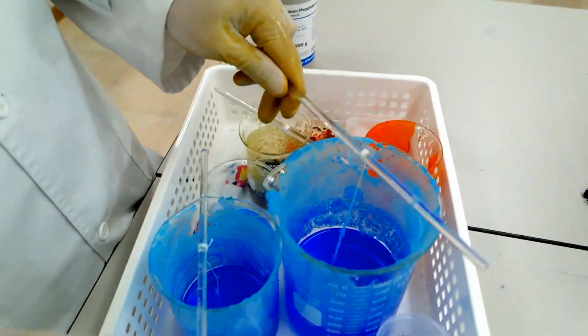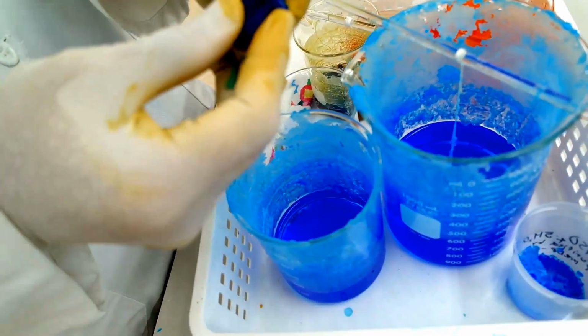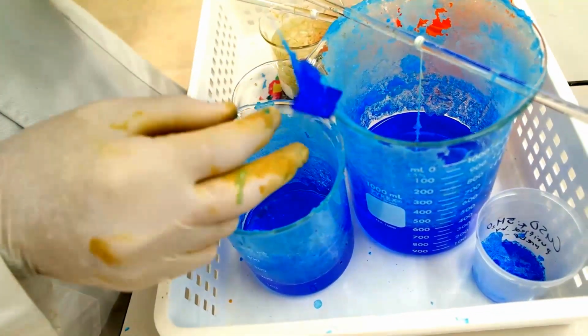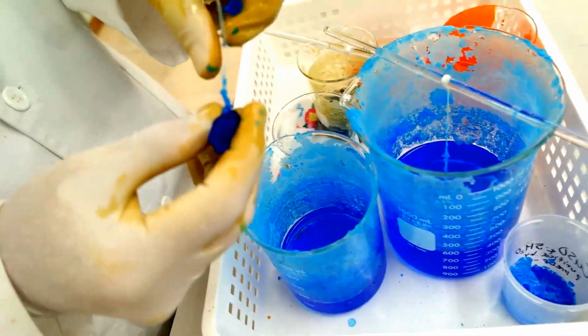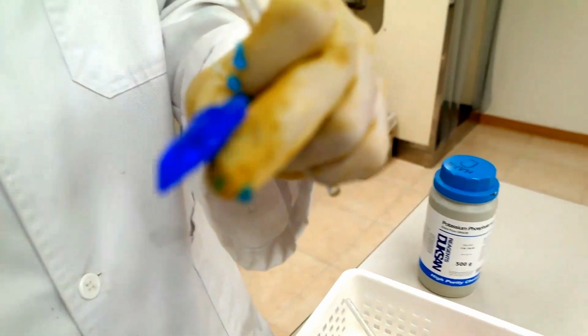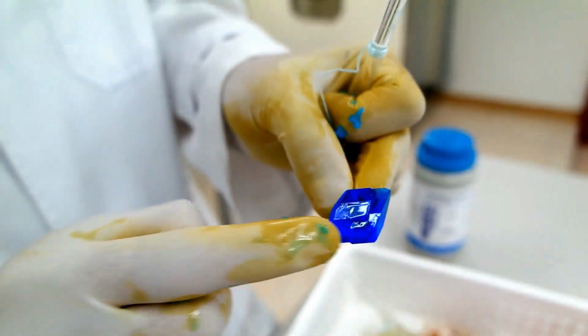So therefore, I made another solution. But the problem with this one was that it wasn't big enough. The seed wasn't. If you have something like this on the top that doesn't look good, just break it off, because it will grow if you don't. I've got another one like this. Although it has failed a bit because you can see double layers.